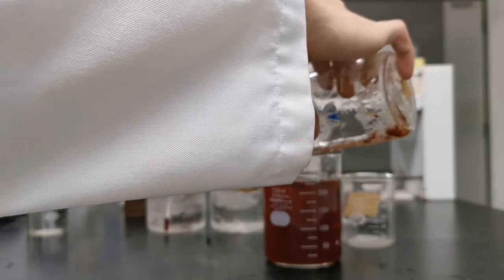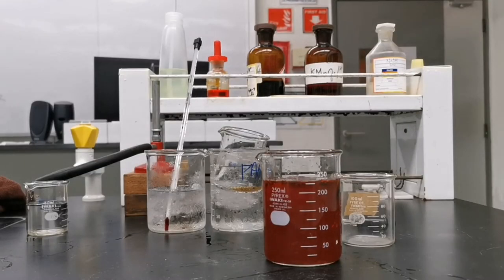I then add my result from the first run into the beaker as well, which I had to say I should actually separate my first result from my second as the precipitate in my first run starts turning black. The solution as well starts turning brown before being filtered off.